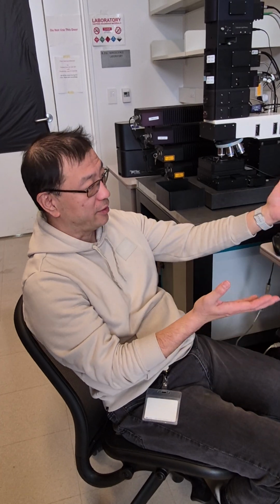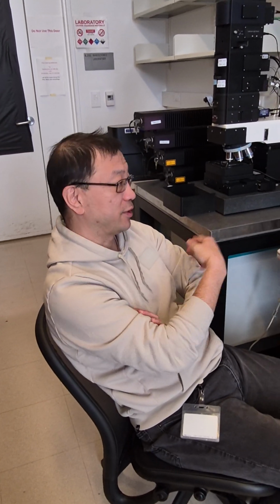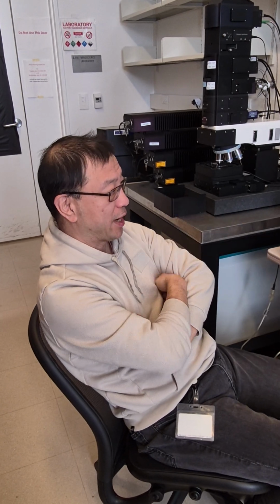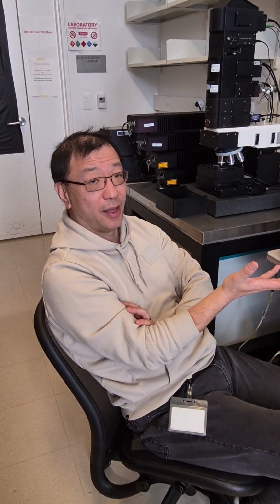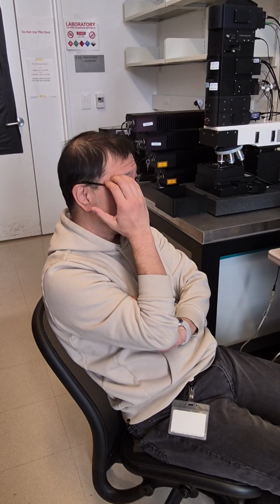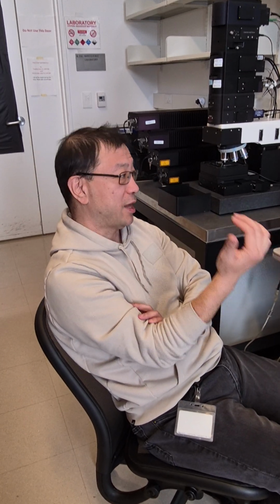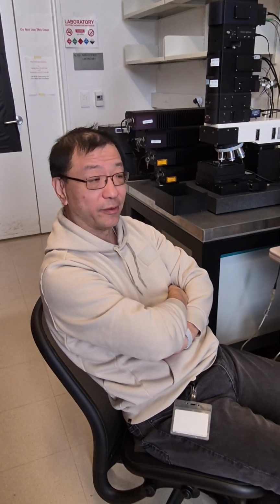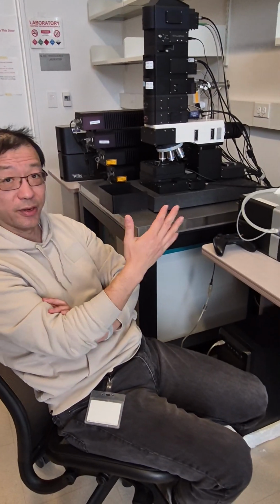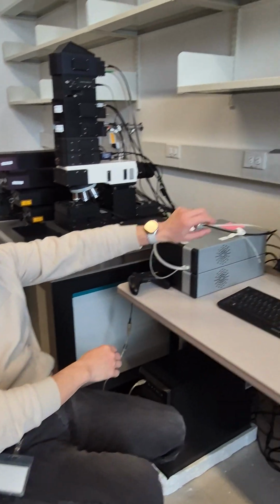10 is the minimum one I always suggest. Even for silicon sample, maybe one-time collection is good enough, but we do 10. It's a minimum. Depending on the sample, you can increase it. But for your sample, you said you have silicon wafer, so 10 is probably good enough for your silicon wafer. If not good, you can increase it, but try not to decrease it. So now we have these two parameters set.